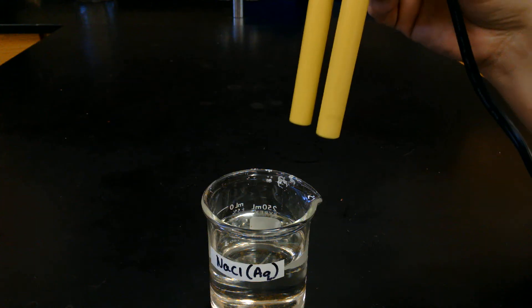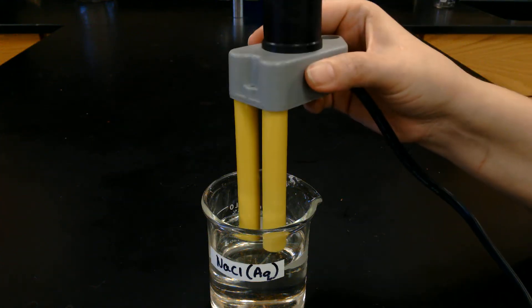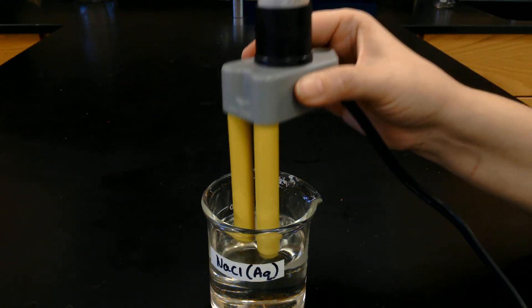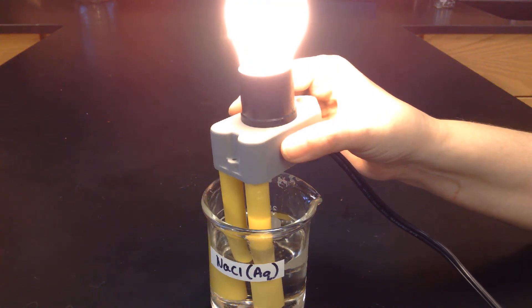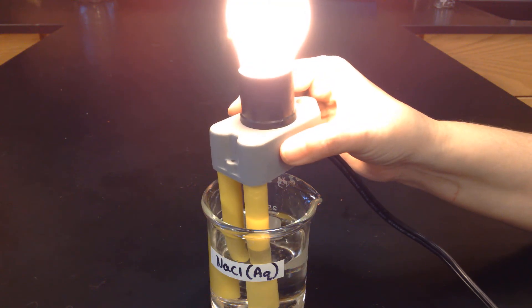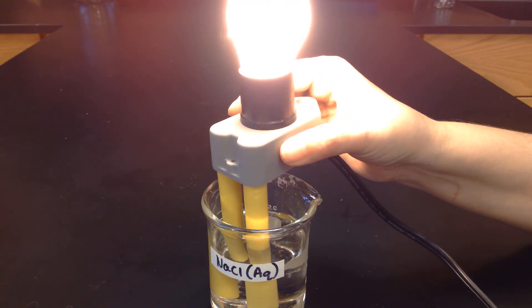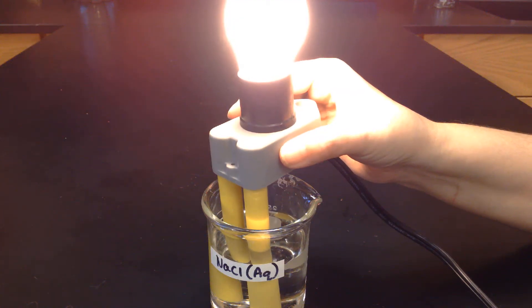Now let's try sodium chloride dissolved in water — that's why there's an AQ for aqueous. Oh man, really bright! Very bright. Go ahead and make your observations.